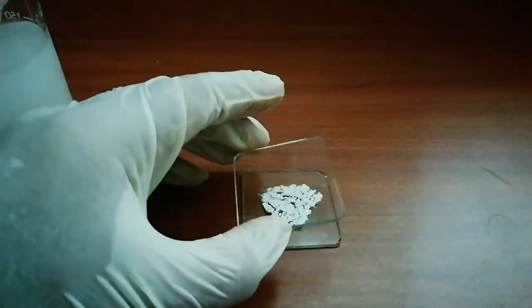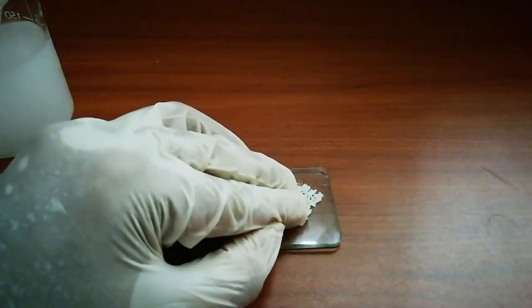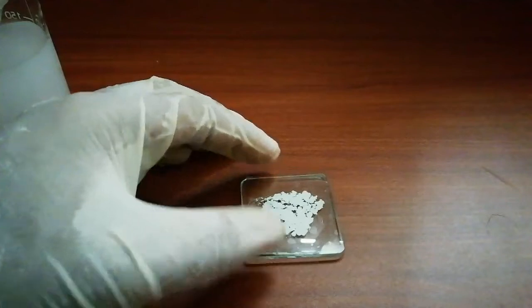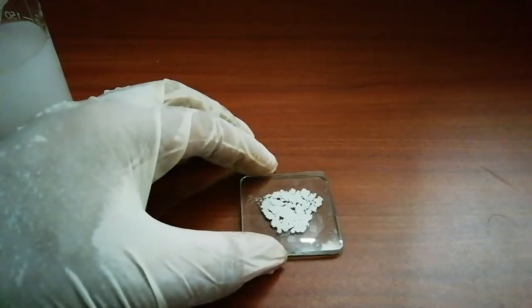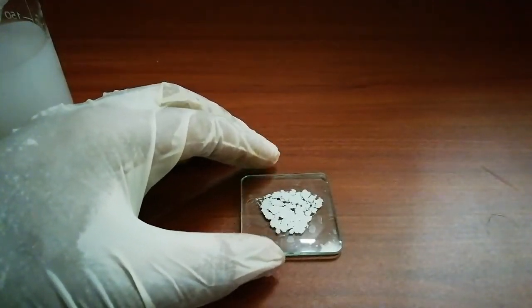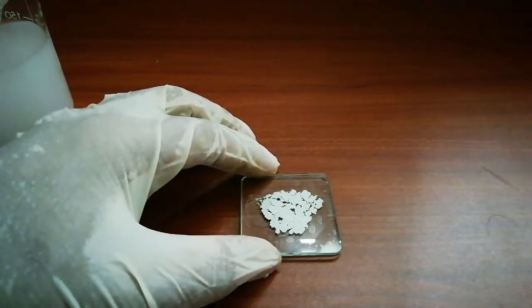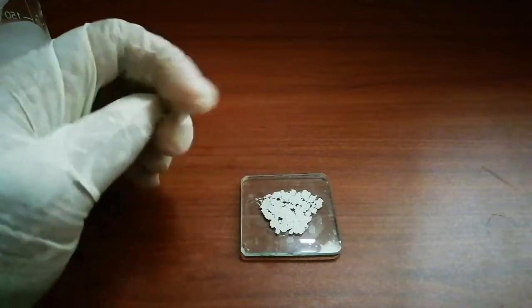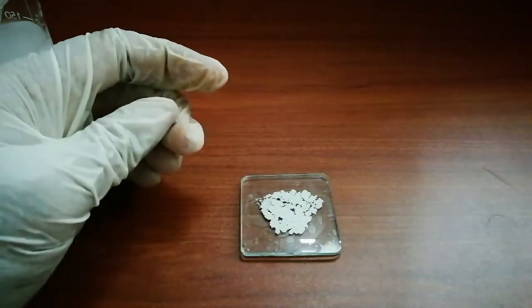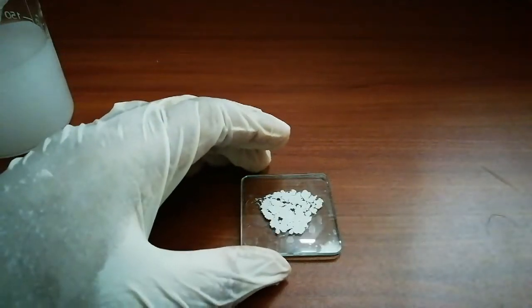Now I put another piece of glass on the silver chloride. Then I let this silver chloride dry in a dark place. Do not keep it in a very light place, because silver chloride will decompose to silver and you can get a very dark colored silver chloride and silver mixture.